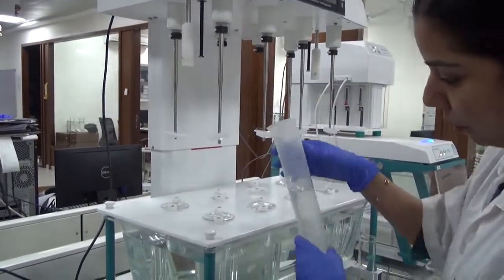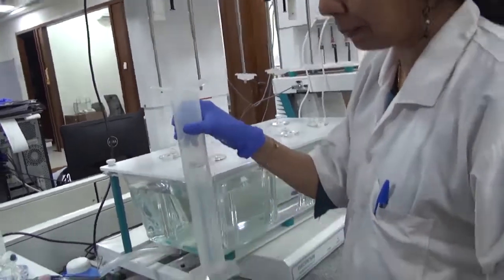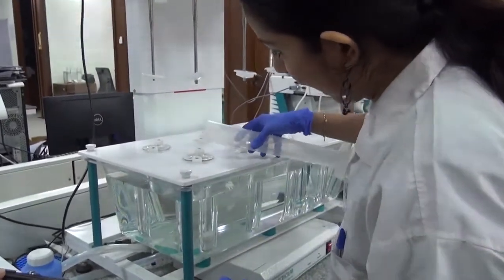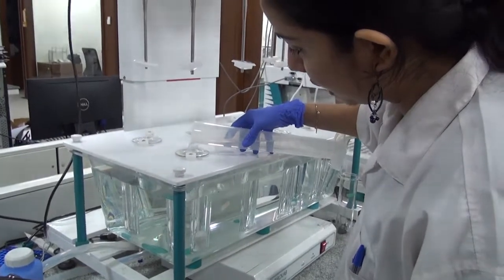You can add 200 ml of dissolution media from the sides.